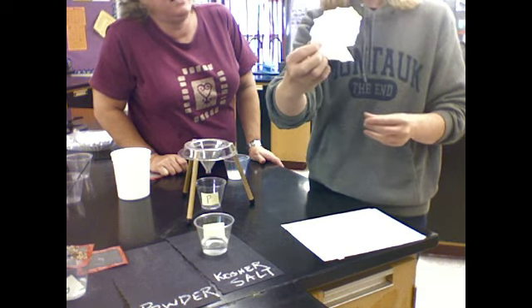Now, sprinkle. I want to do the sprinkle. So always just sprinkle a few drops. And that just helps the water go through more quickly. Exactly. And I know some of you may have seen these filter papers before. If your parents drink coffee, you may see those quite often, and they are similar shapes and work kind of the same way.